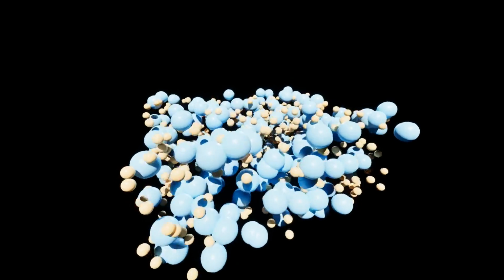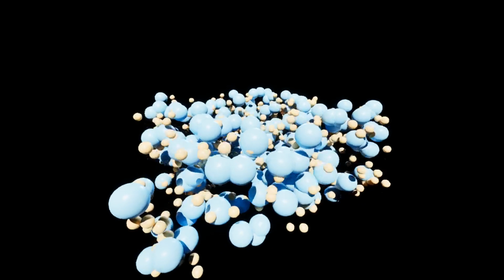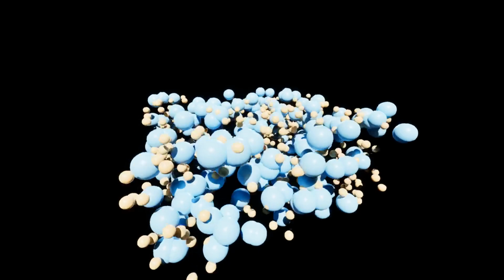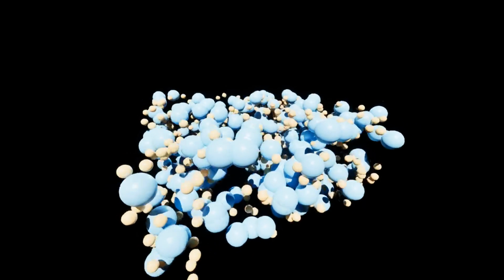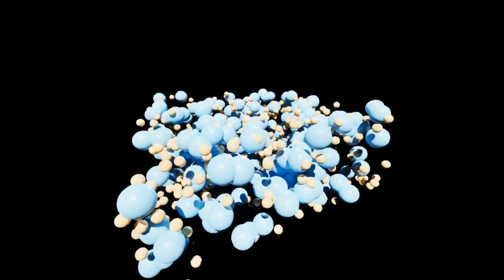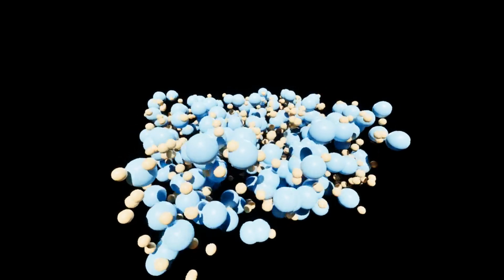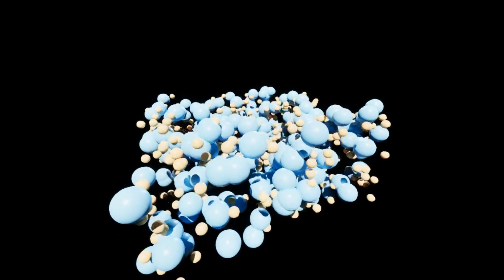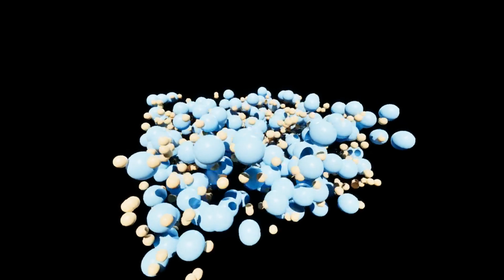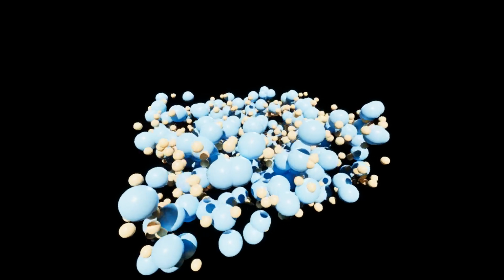The plugin ships as 5 runtime modules in C++, with 53 automation tests that run offline, and 3 more that exercise the live archive servers. 3 example levels are included, each generated by a script so you can rebuild them after any change. 3 demo structures come with it: crambin, green fluorescent protein, and human deoxyhemoglobin. It requires Unreal Engine 5.8 on Windows and depends only on engine plugins that ship with the editor. Nothing to install. MolecularForge, real structures in your engine.